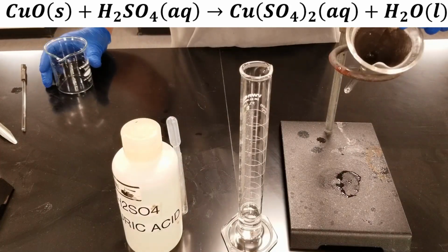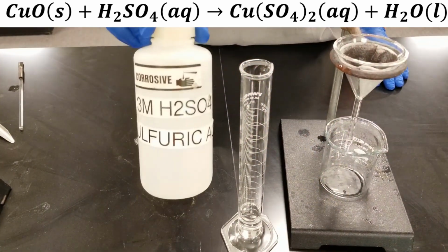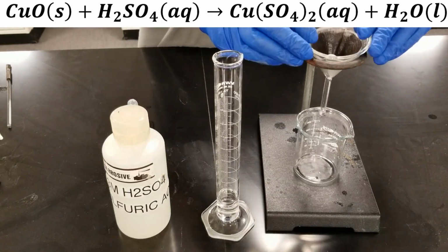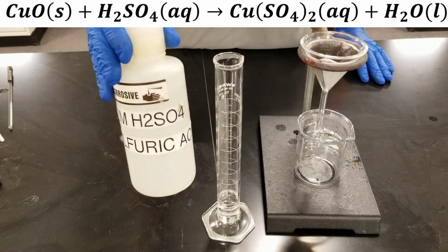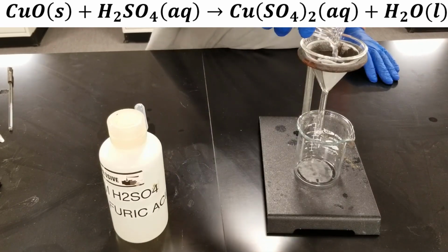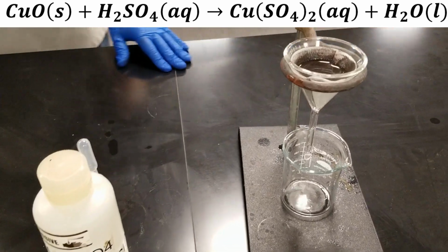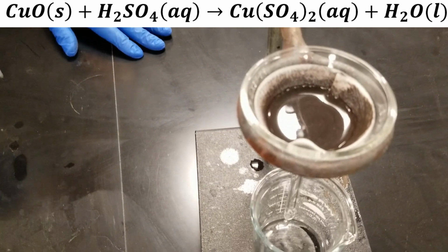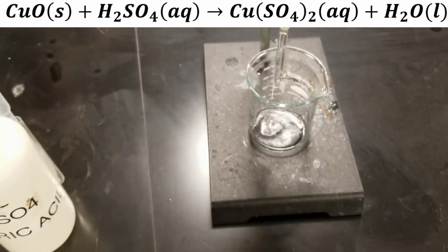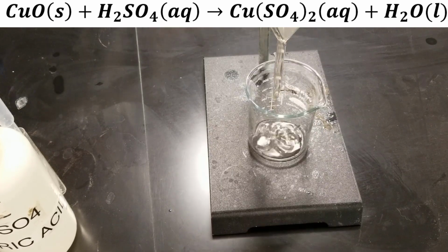Now we're going to take our copper oxide and we're going to dissolve it in sulfuric acid here. I have 20 mils of sulfuric acid. We'll pour that in. It will take a minute or two, but you'll start to see a blue solution of copper sulfate come out the bottom. Now, the 20 milliliters of sulfuric acid is not really enough to dissolve all that copper oxide.